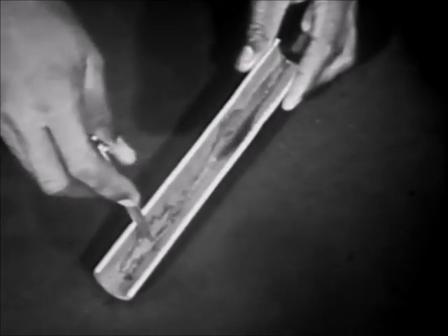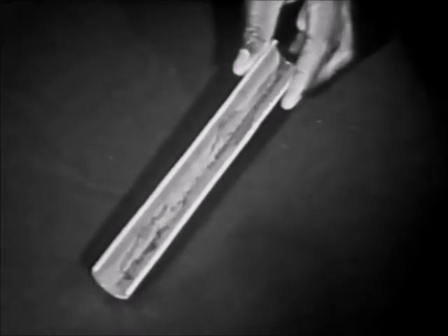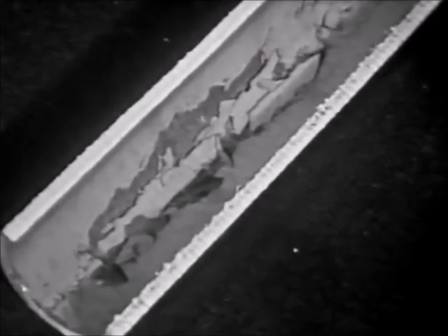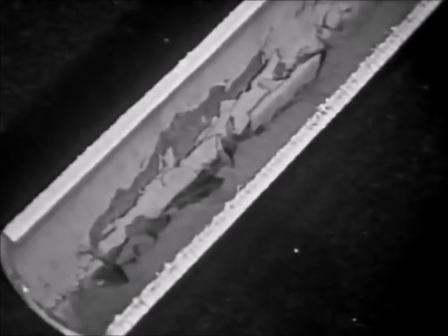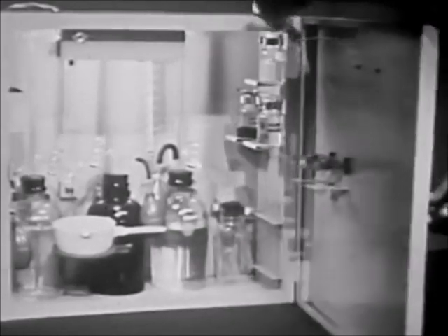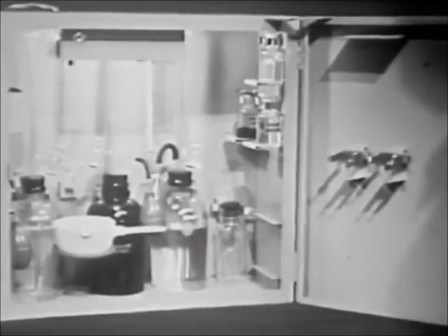The deposit in this boiler tube was caused by solids in the boiler water, a condition caused by seawater contamination. To prevent this, the chloride content of boiler water must never exceed prescribed limits. Both boiler water and feed water must be tested at specified intervals. In this film, you will perform the chloride test. The procedure is the same for both boiler water and feed water.